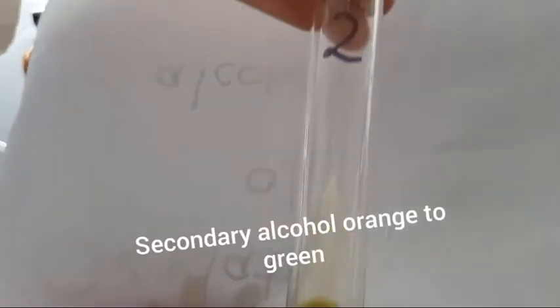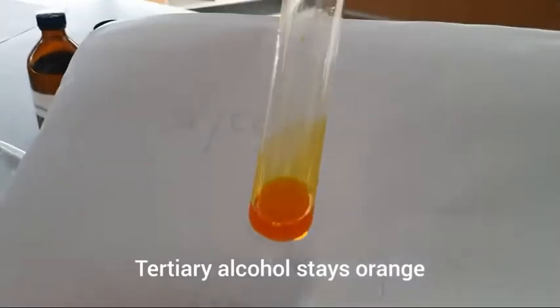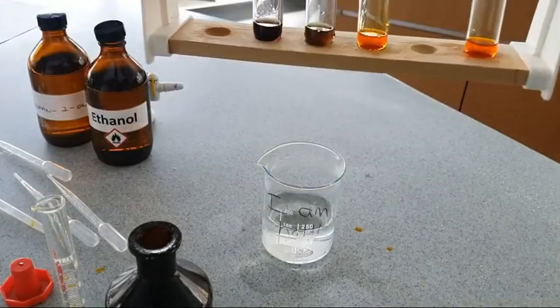In test tube 2, where we had our secondary alcohol, again we've definitely seen a colour change. It's gone from orange to green. Whereas in test tube 3, it's definitely stayed orange. No oxidation has occurred. Tertiary alcohols cannot be oxidized with acidified potassium dichromate.